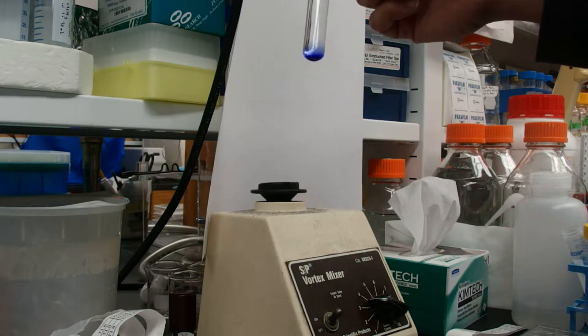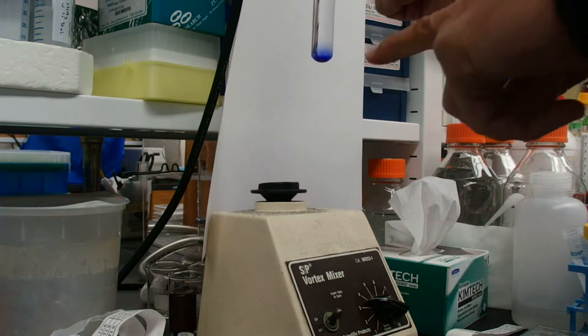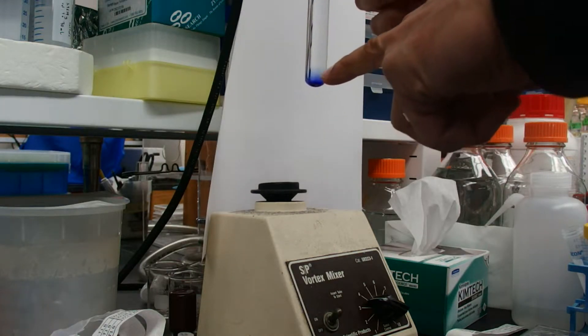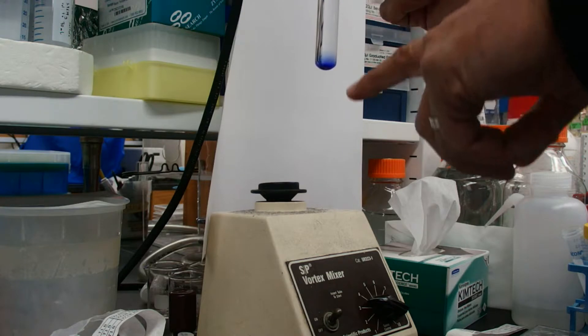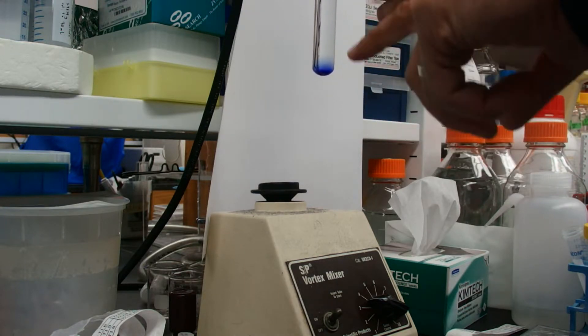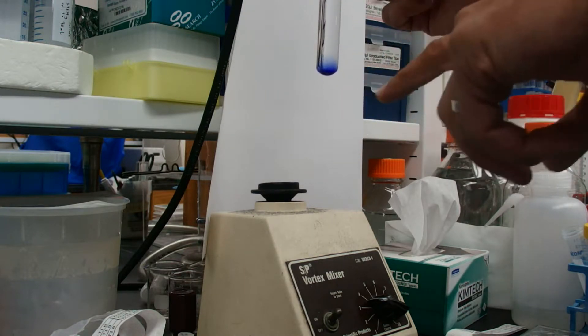What you can notice right away is that mixing doesn't happen automatically. The dye is still staying right here in the bottom of the tube, and it is not diffusing throughout the rest of the water to become an even blue color.